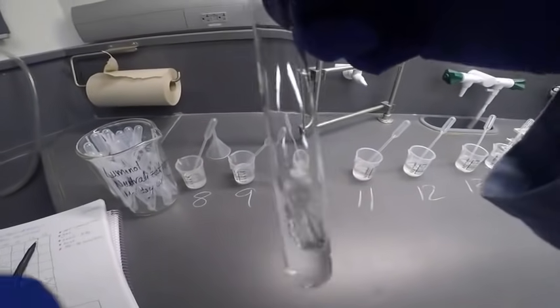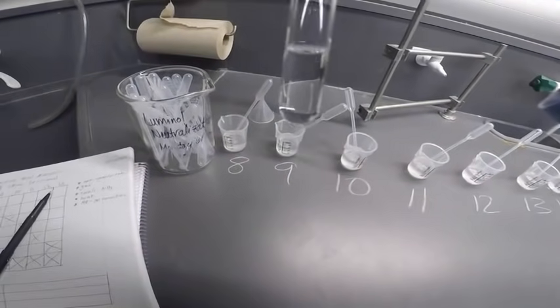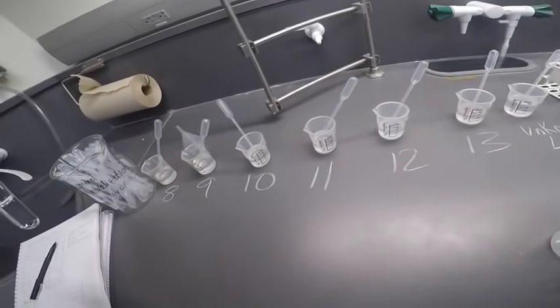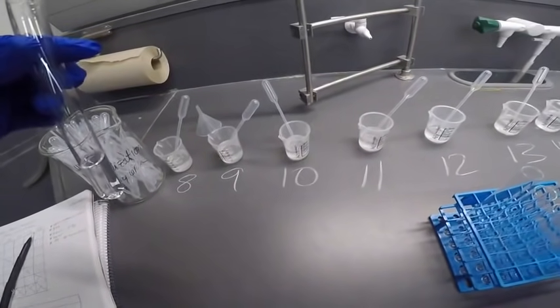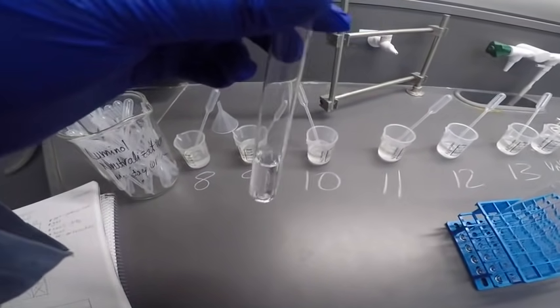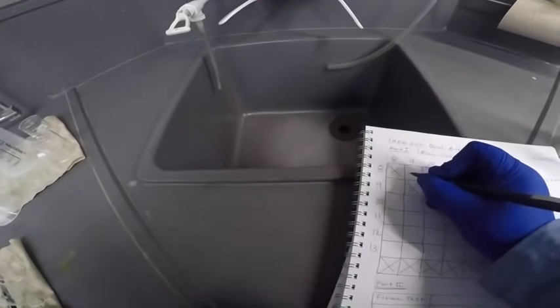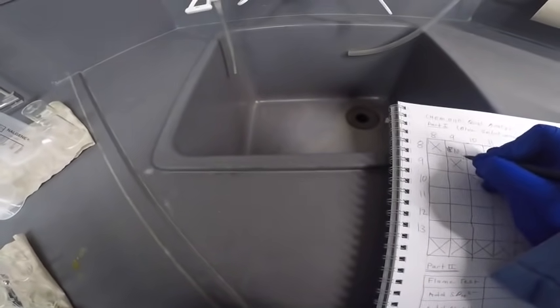So I don't see a precipitate there. Let's feel the test tube. Let's put it on my wrist here so I can feel if it's getting warmer. No gas formation, didn't see any bubbling. All right, let's bring everything over here a little closer to me. Let's do a smell test here. No smell. Looks like that was no reaction. All right, no reaction. I'm going to write that down in my notebook. I want to keep track of this myself. So NR.